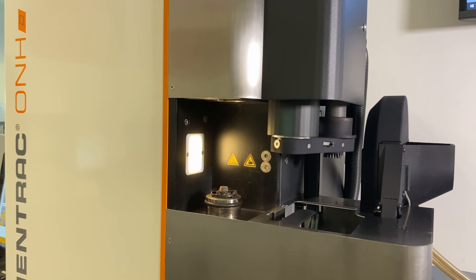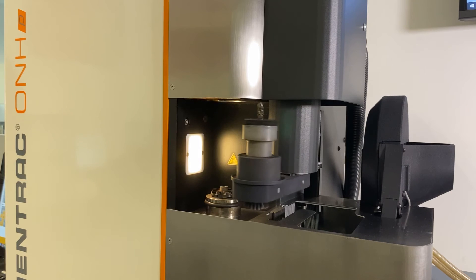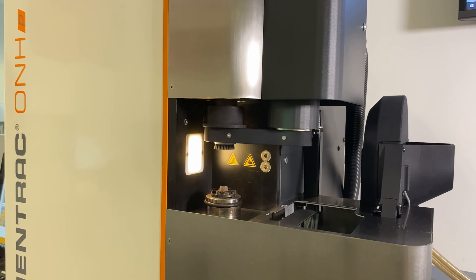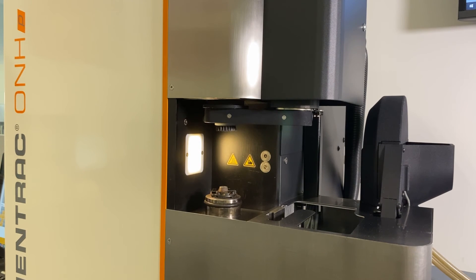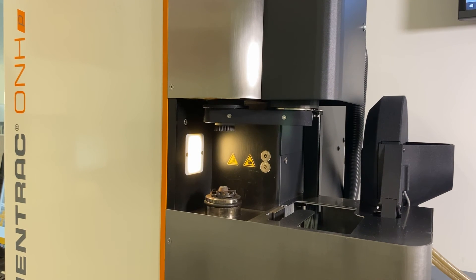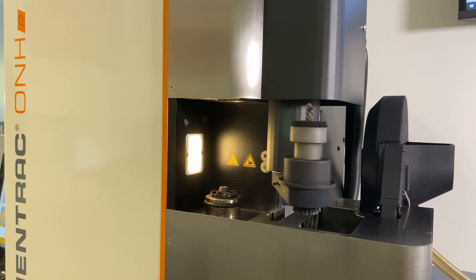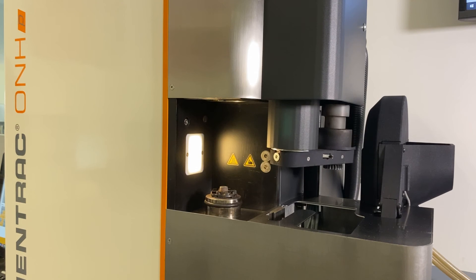Depending on the sample matrix, the auto cleaner can be used during auto loader operation to clean the furnace chamber and the crucible tip, ensuring long-lasting reproducibility of results. Contact us or one of our distributors to learn more about our auto loader and its benefits.